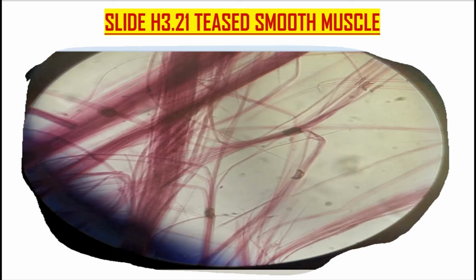Teased smooth muscle slide. What does this mean? Teased smooth muscle simply means that the connective tissue has been removed, and now you only have muscle fibers.